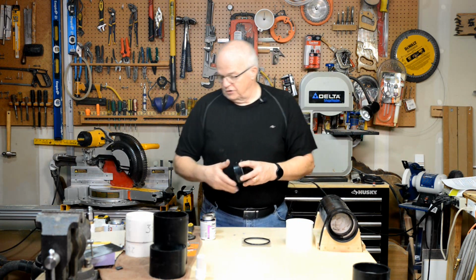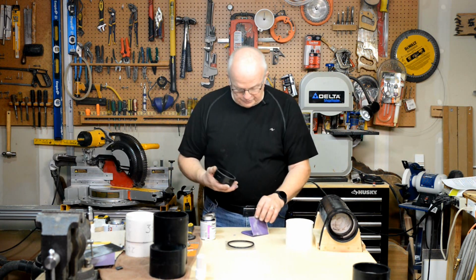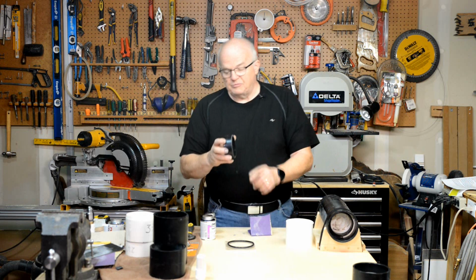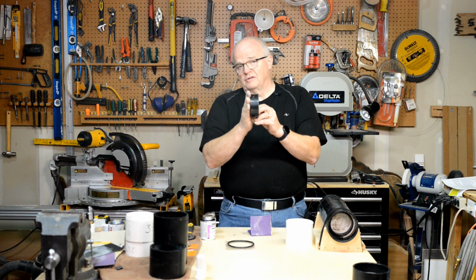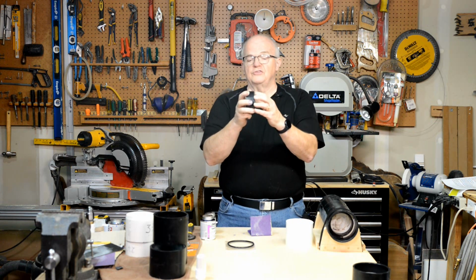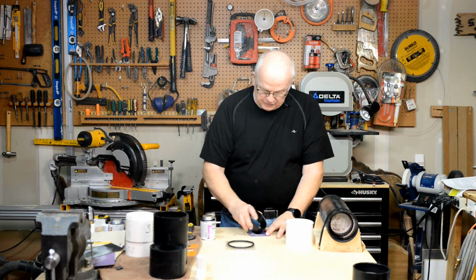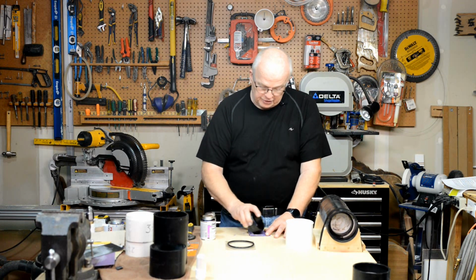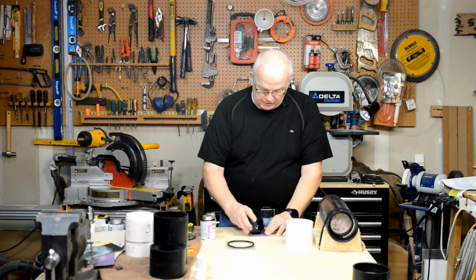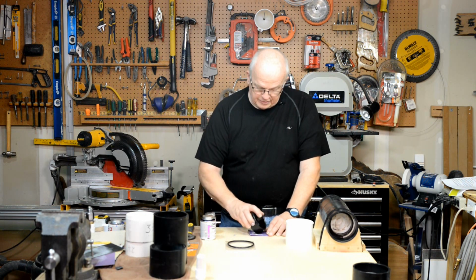And so what I have done to remedy that is I've taken a piece of 80 grit, and I've put a little bevel on this edge. Not the factory side, not the molded side, not the smooth side, the side that you cut. You want to go along there and you want to put just a little bit of a bevel all the way around that. It doesn't have to be very much. The only reason that you're putting it on there is to make it easy to stick inside there when it comes time to glue it in here in a few minutes. So give me a minute and I will finish with that.